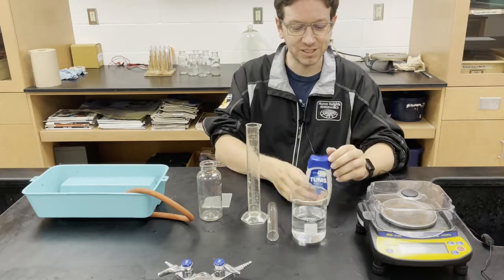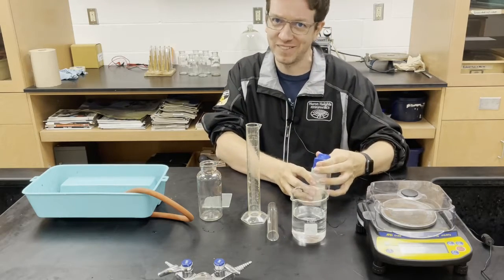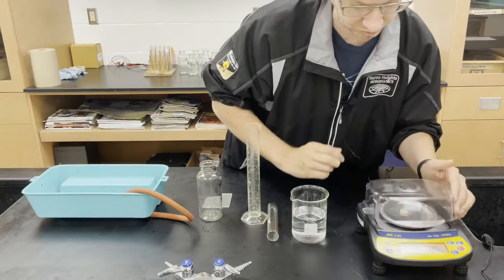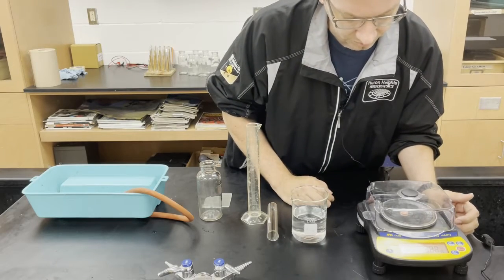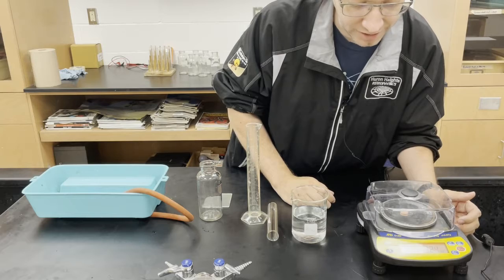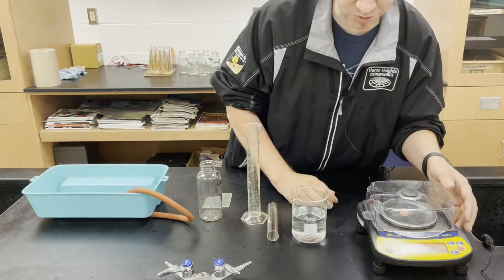So first, let's figure out the mass of one of these tablets. We have a mass of 1.326 grams.